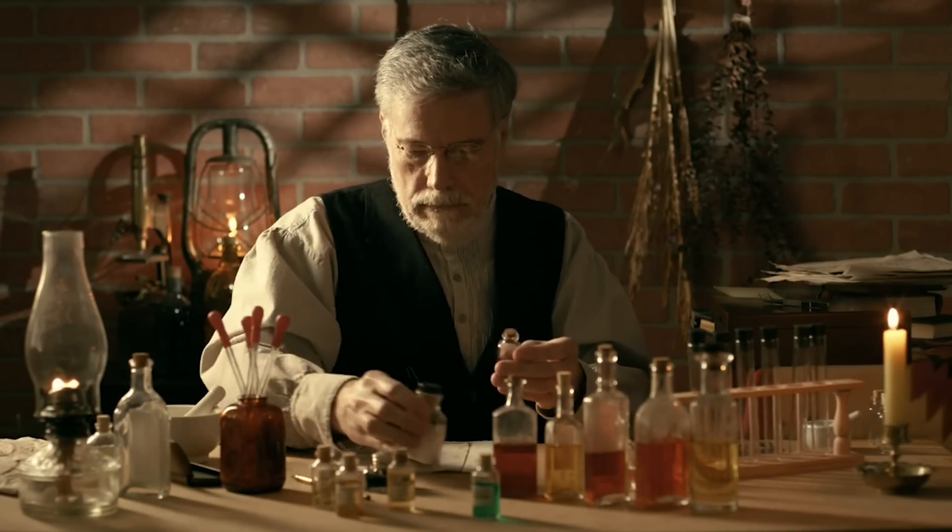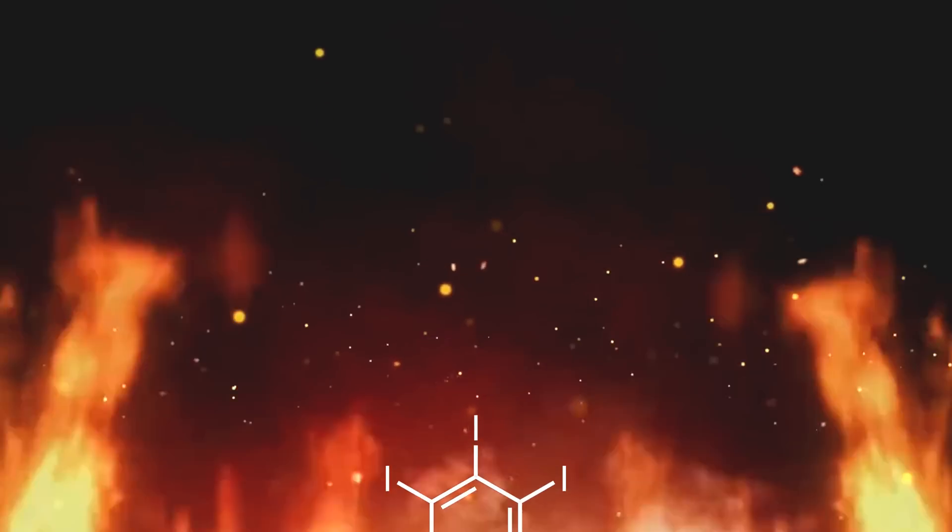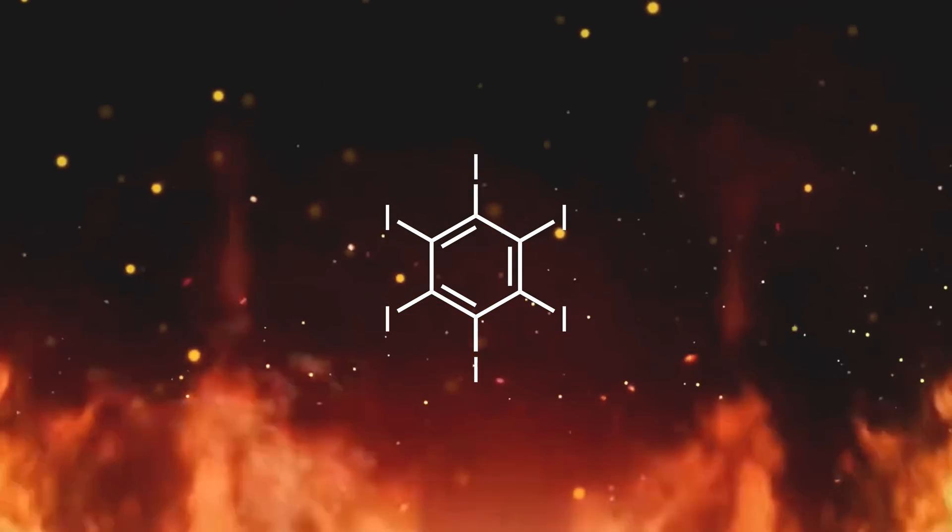Called hot, fuming sulfuric acid with an excess of iodine. What arose from this pit was the thick, dense monstrosity called hexaiodobenzene.